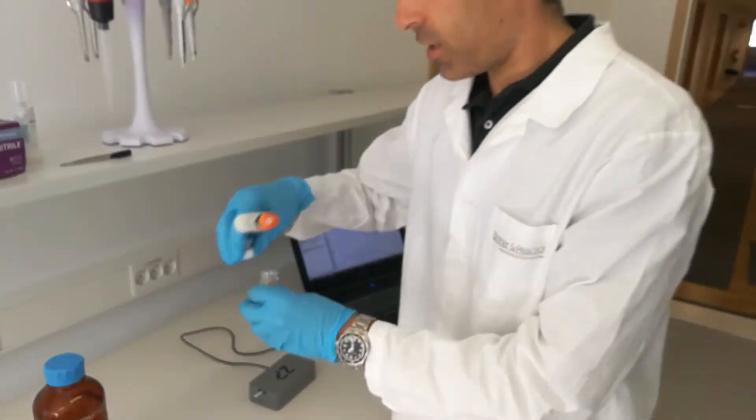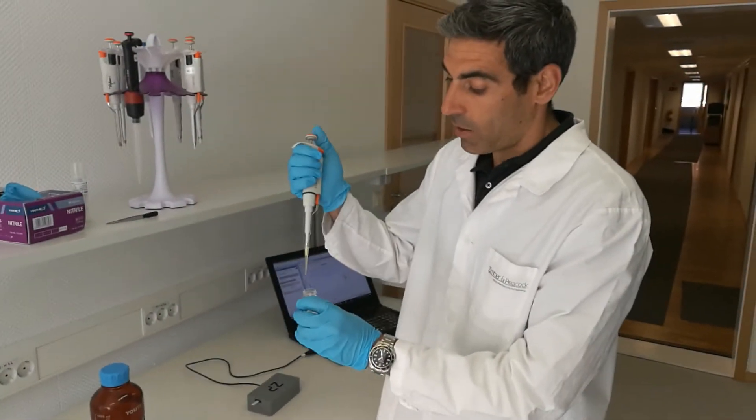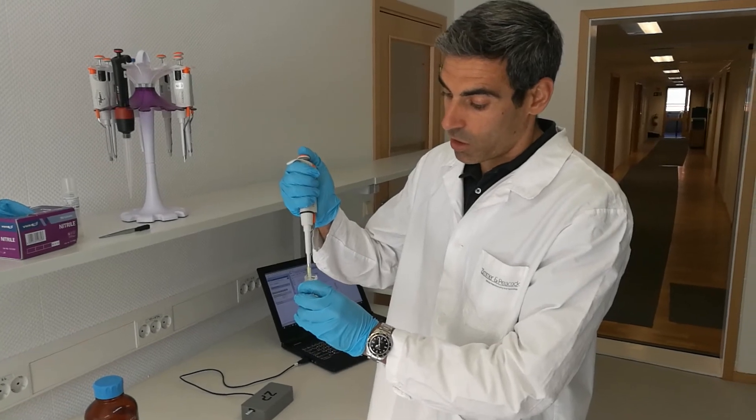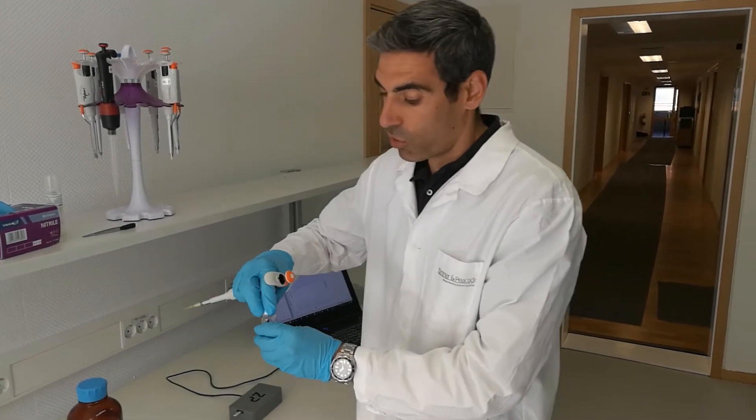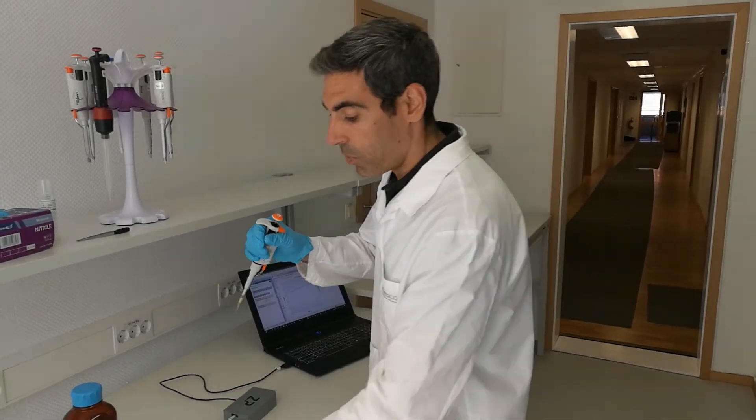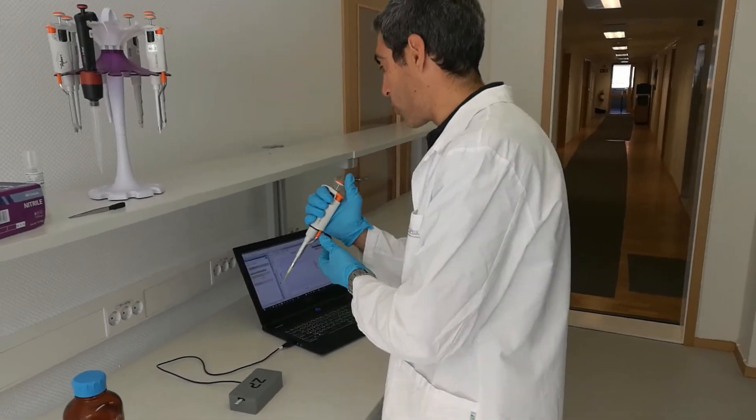In this case, I don't actually know how much concentration I'm going to change, but I'm just going to add a bit so that you can see the step showing the change in concentration.